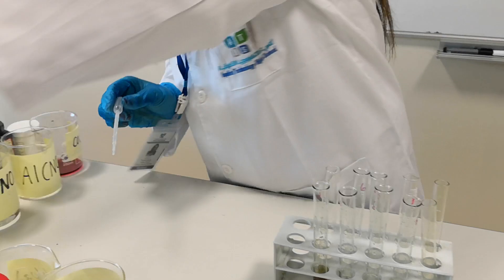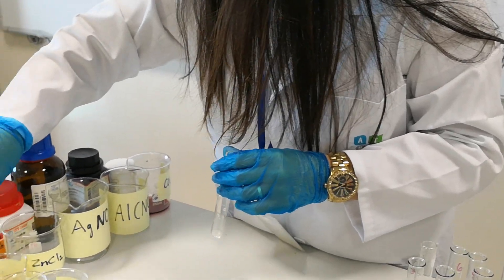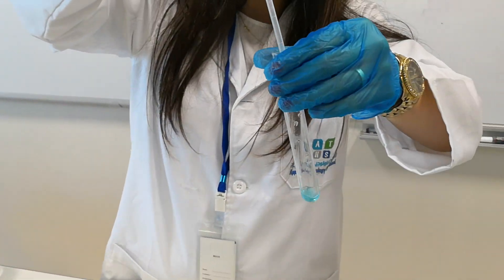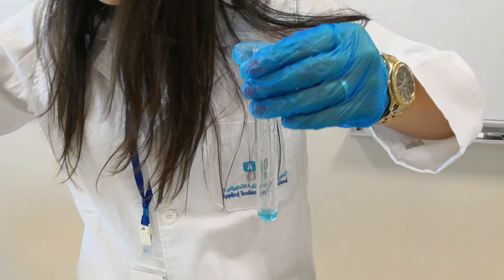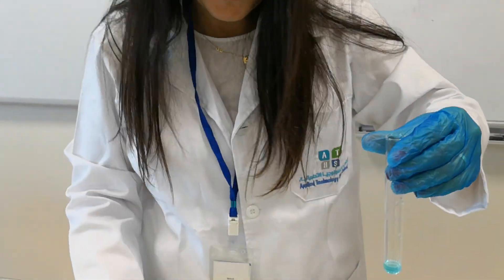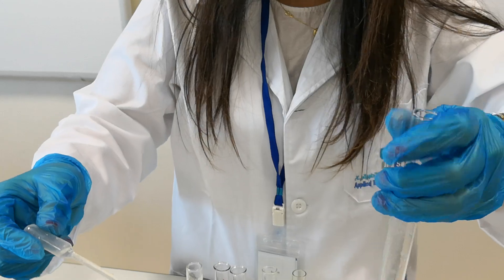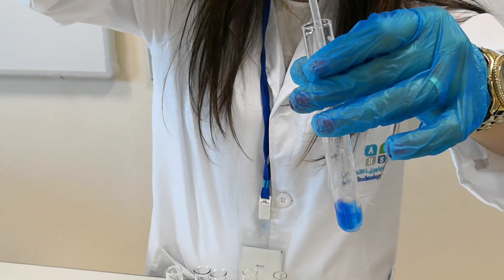Now let's try copper. The copper is a blue solution — copper(II). Upon adding sodium hydroxide, it gives a blue precipitate.